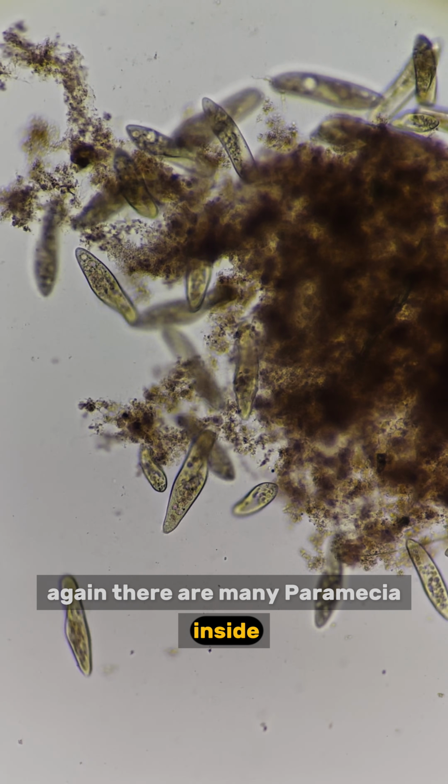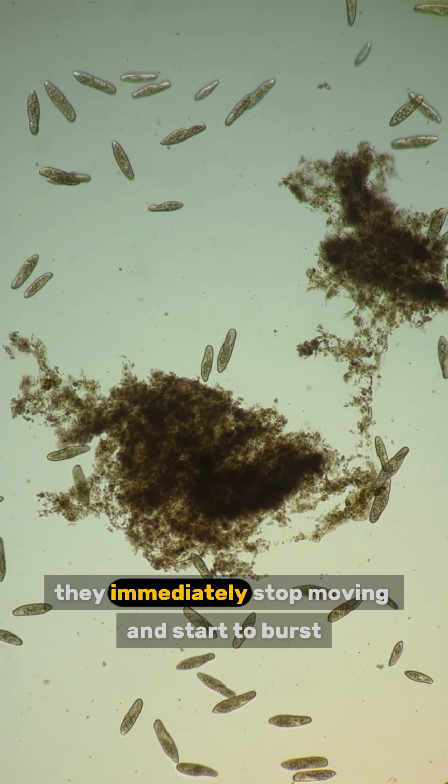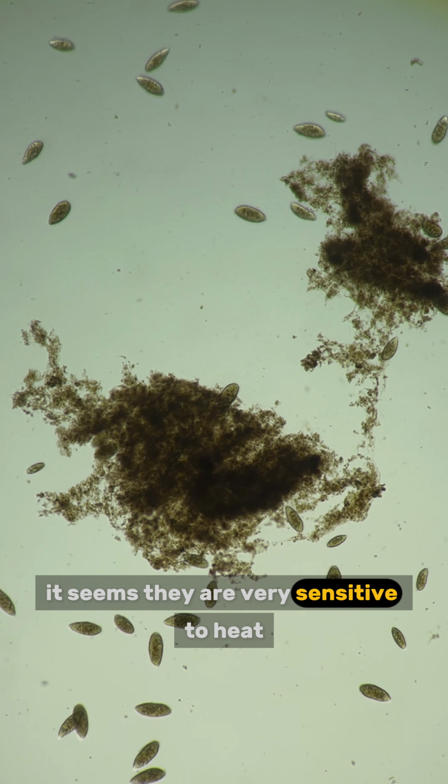Again, there are many paramecia inside. I have prepared a new experiment for them. Let's heat the slide for a few seconds. They immediately stop moving and start to burst. It seems they are very sensitive to heat.